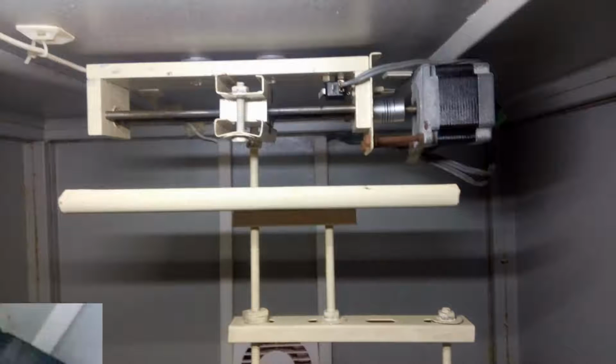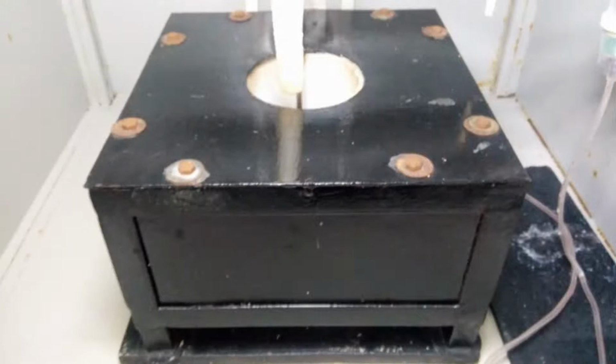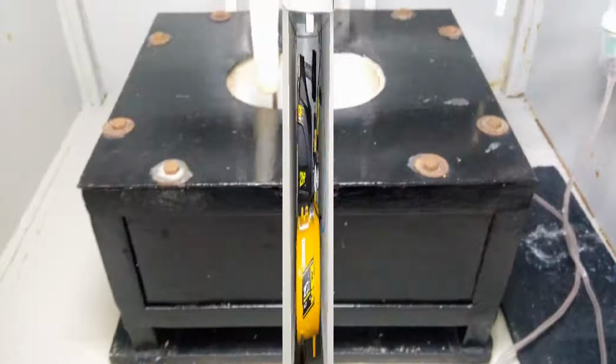of the substrates. This is the close view of the stepper controlled rotating substrate holder and the exit of the droplet guiding tube. The temperature of the substrate holder is monitored and controlled using a PID controller through the given thermocouple, which is touching the substrate holder firmly. The furnace shown in the photograph is roughly a 2 kilowatt furnace. The temperature of the furnace is controlled using a digital SCR driven by a Selec make PID controller for increased temperature withstand during the deposition.